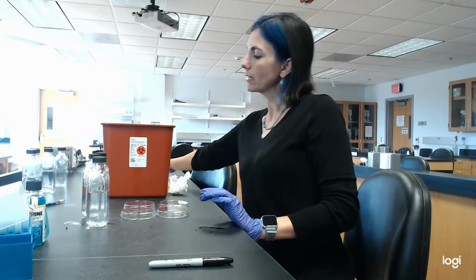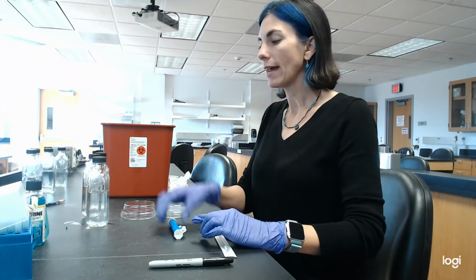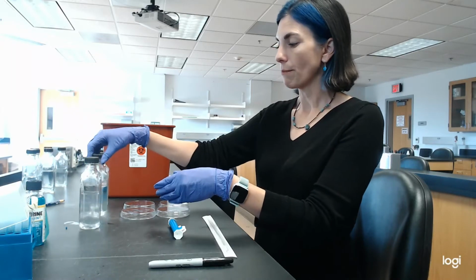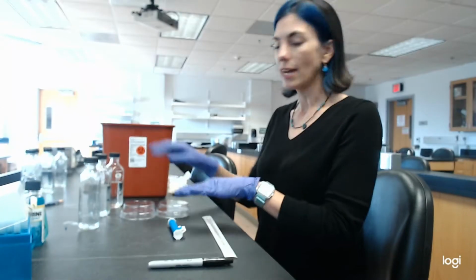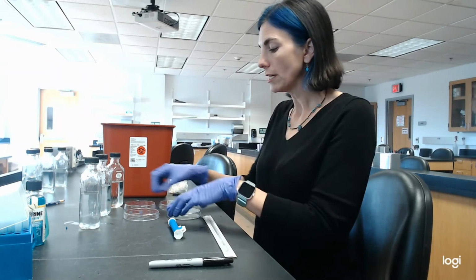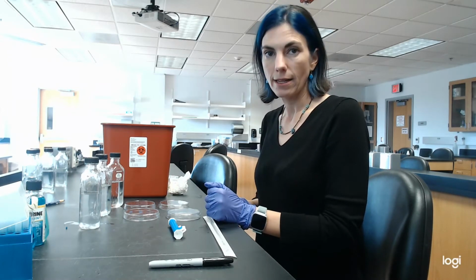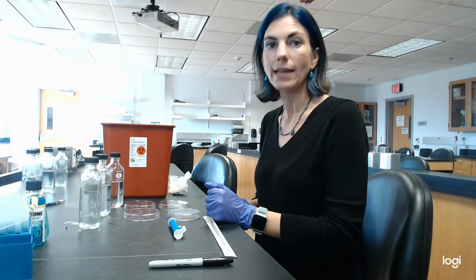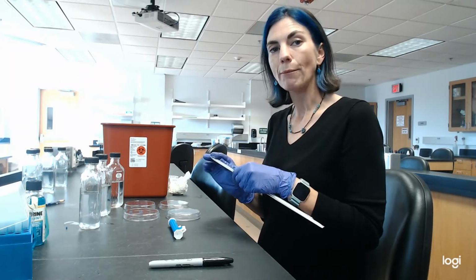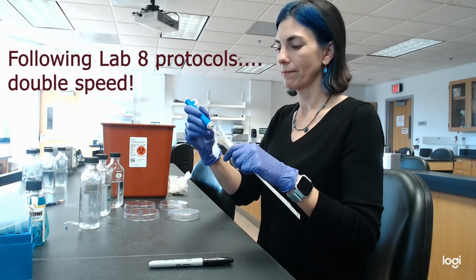And now what I'm going to do is follow Lab 8 procedures to do my set of serial dilutions. So you'll recognize that I have my 3 bottles up here, A, B, and C. And just like Lab 8, I'm going to have 4 Petri dishes. And my dilutions are going to be 10 to the minus 4, 10 to the minus 5, 10 to the minus 6, and 10 to the minus 7, exactly as prescribed in Lab 8. All right, so I'm going to go ahead and do that.